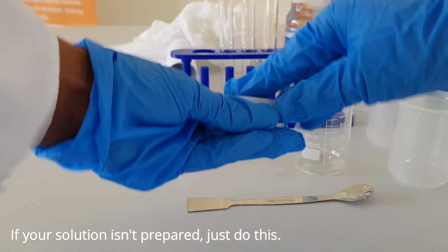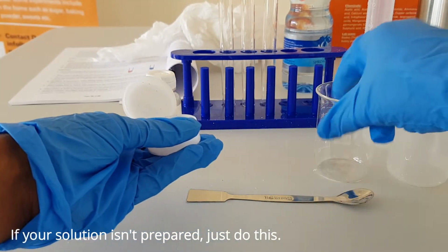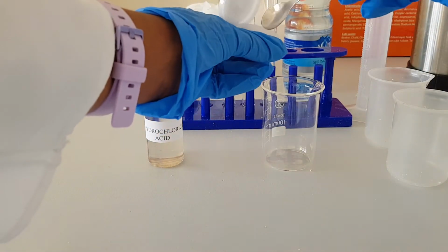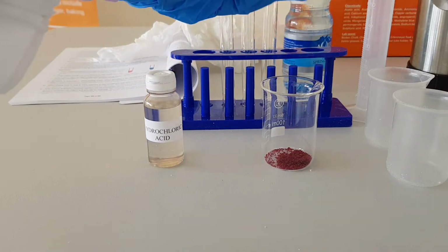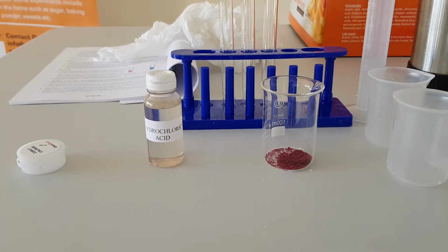You will first dissolve 2 grams of cobalt chloride, which is this whole amount. You dissolve it in 25 ml of water.